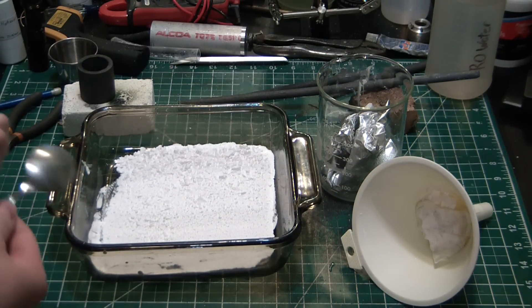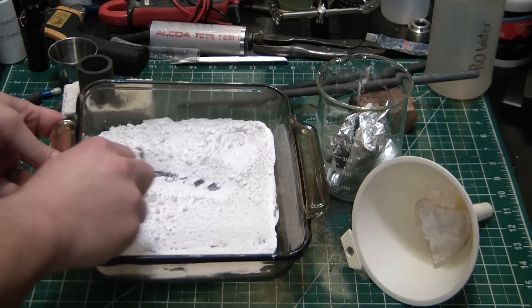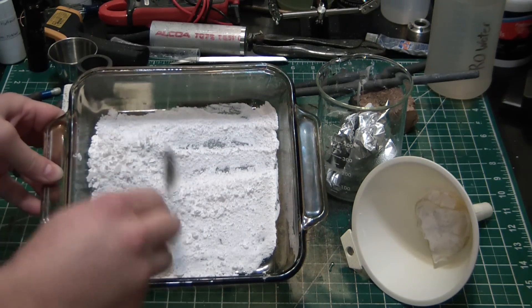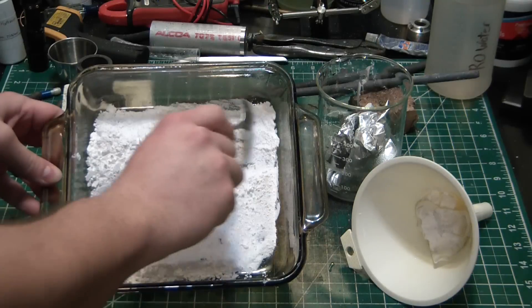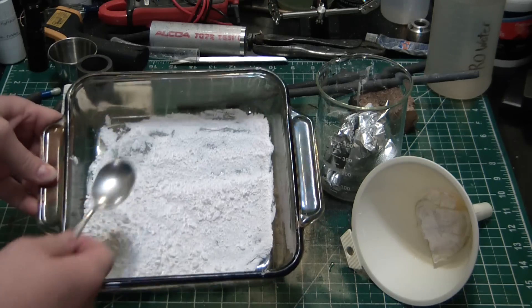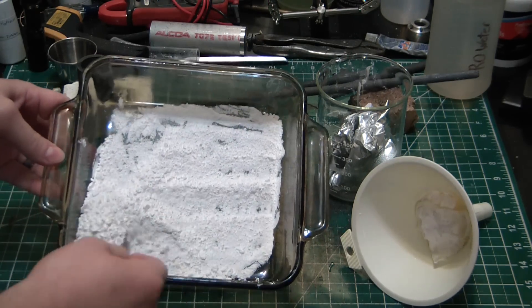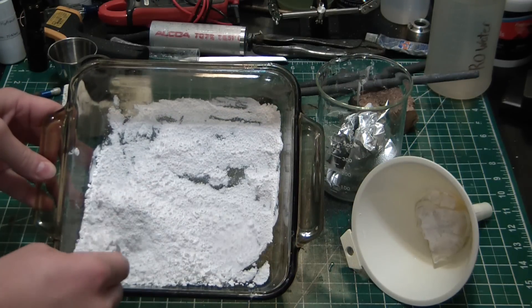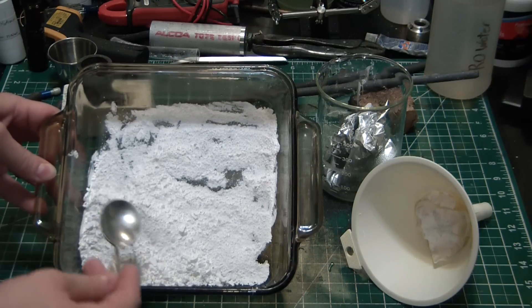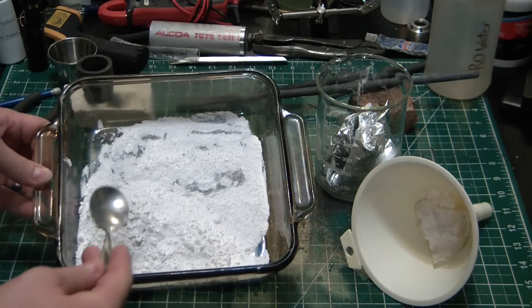It looks rather illegal, you know, bringing a white powder out of your oven and whatnot. And it sticks to the glass like crazy, so you really got to scrape it off. Hopefully it didn't transfer too many calcium ions to the glass and ruin the borosilicate glass. I think it'll be fine. So from here I'm just going to bottle it. It should work fine for our purposes. I might run it through a coffee mill just in case I need fine powder for any future experiments, but this will work fine for what I have in mind. You guys should probably be seeing that video pretty soon. And there we go, calcium hydroxide.